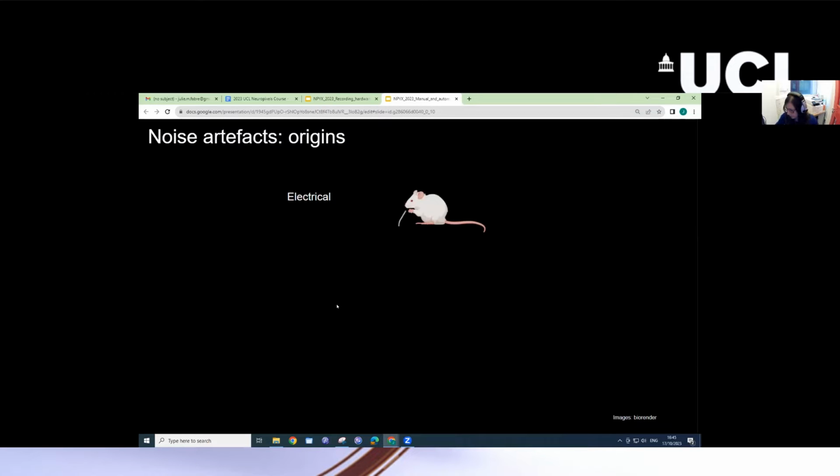So first, let's talk about one of the biggest problems of spike sorter outputs, which is noise. Noise can occur for a lot of different reasons. For instance, electrical noise can occur if a lick spout is not grounded. When the mouse touches the lick spout with its tongue, that can result in a noise artifact. Similarly, movement of the mouse can cause large noise artifacts. When the mouse moves, you can have movement of the brain relative to the probe.